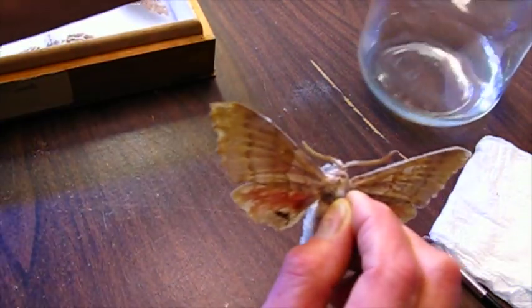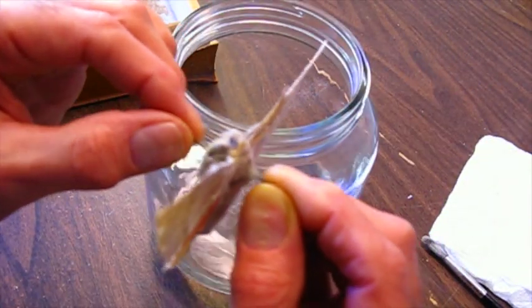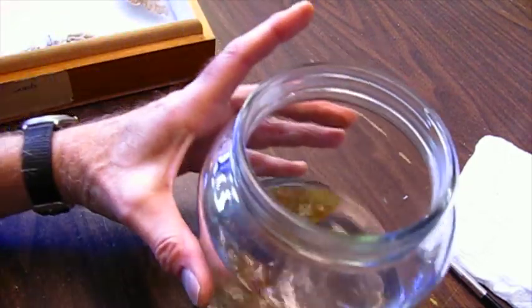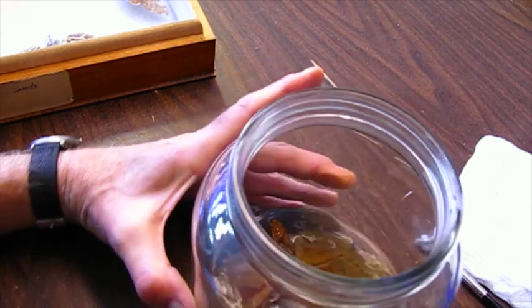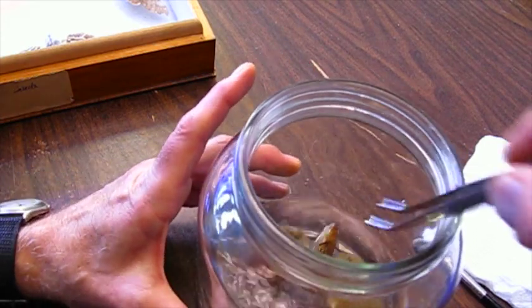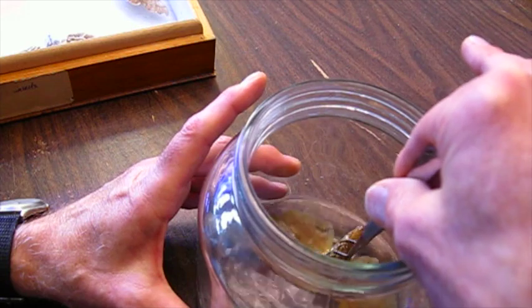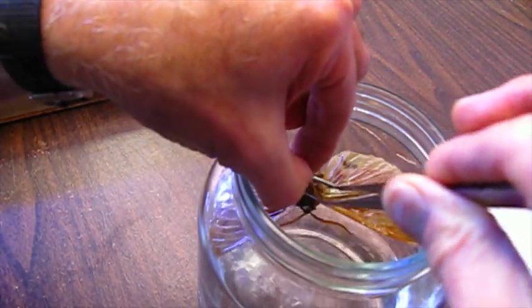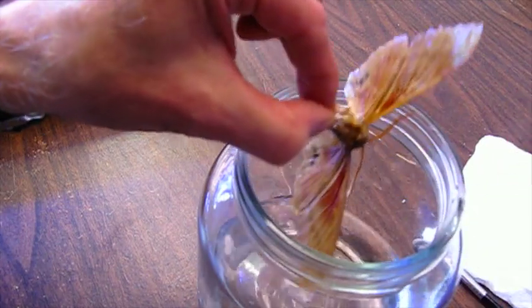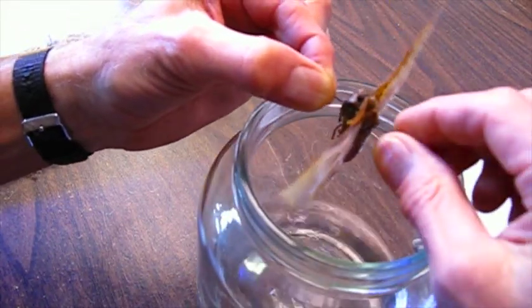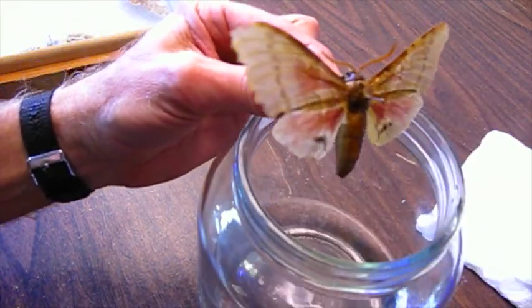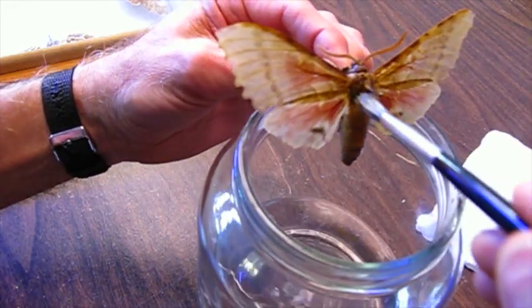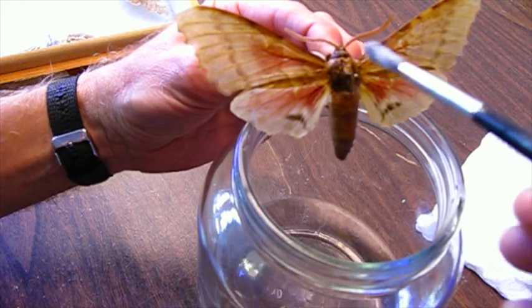I'll do the same thing. This one's pretty wide, but I think it'll fit in here. Let that soak for just a moment. I'll reach in with my tweezers and get a hold of the pin. Dip the brush in the acetone. Gently stroke it.